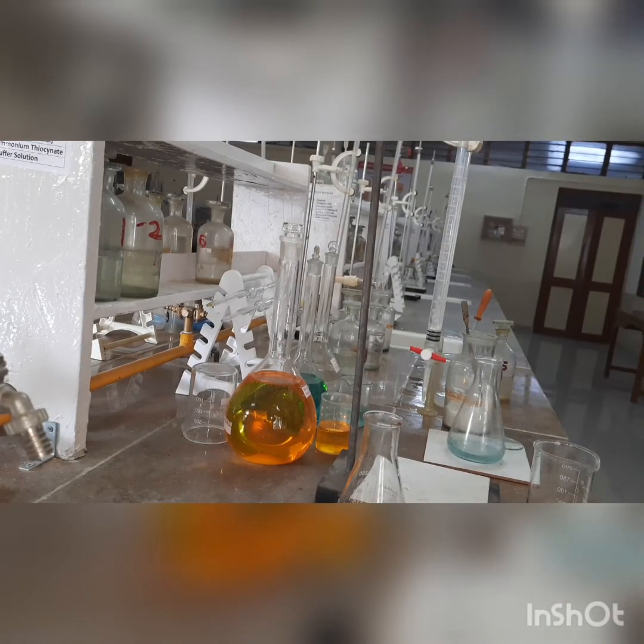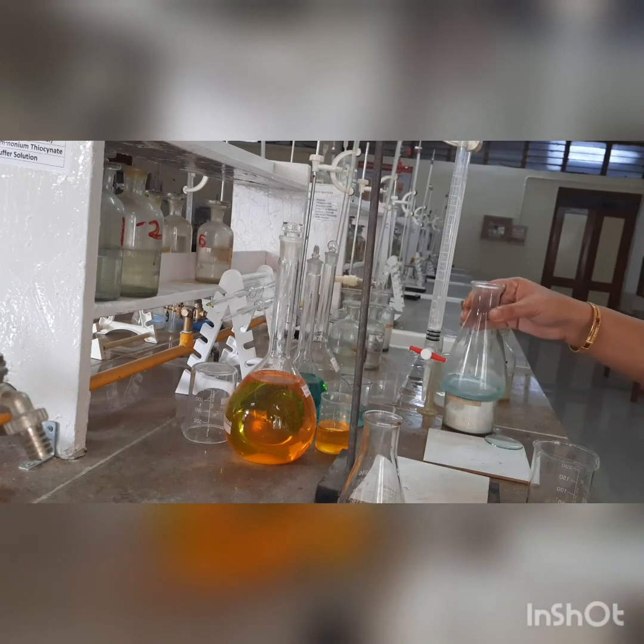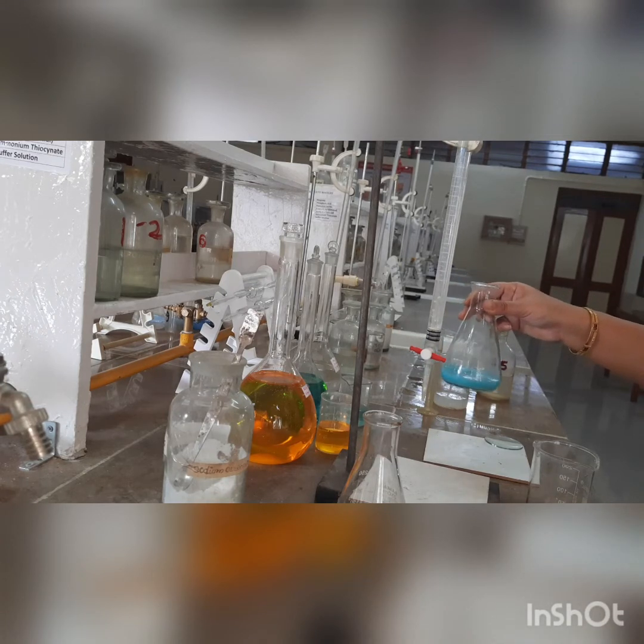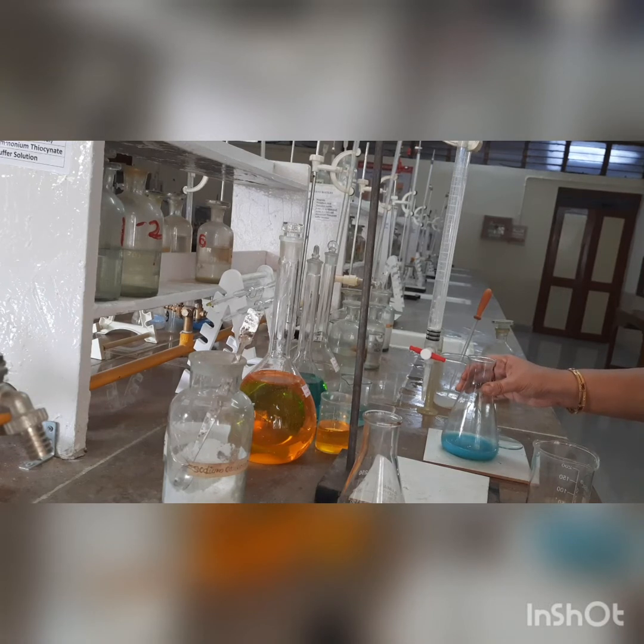Let us start the estimation of copper. We have taken 25 ml of the given copper sample. To this, we add a small amount of sodium carbonate using a spatula — a little bit of sodium carbonate goes in. This will form turbidity. You are aware that acid and base are going to form a salt; this salt we are going to dissolve with a little bit of glacial acetic acid. We will take some glacial acetic acid and dissolve this turbidity with it.